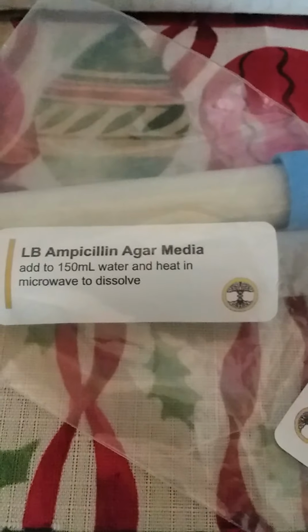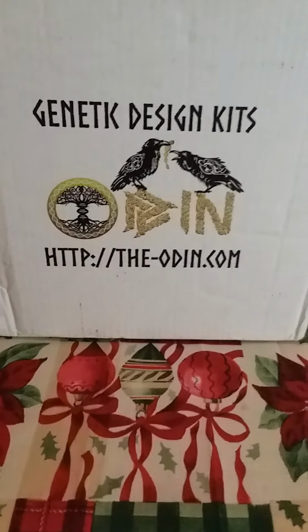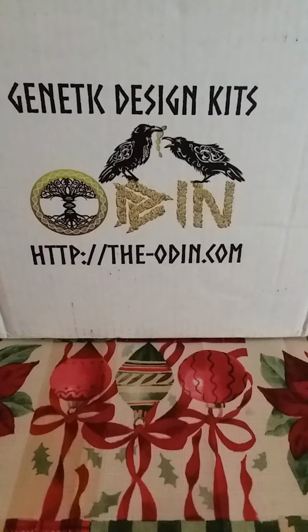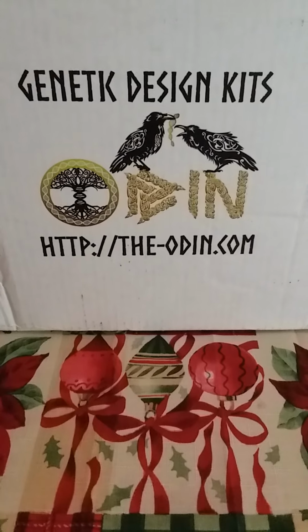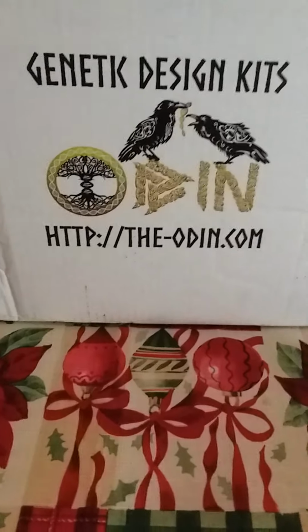Now, as it turns out, ampicillin is an antibiotic and it kills germs, or bacteria in this case. So if you're wanting to culture bacteria, that's not the best medium to do it in. So let's take a look at the results and see what happened.